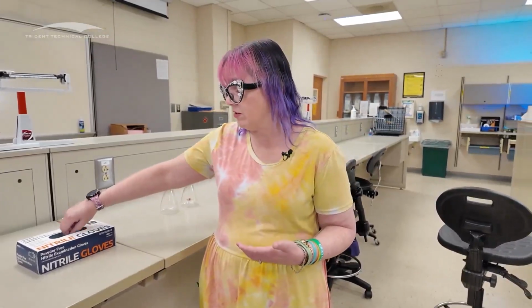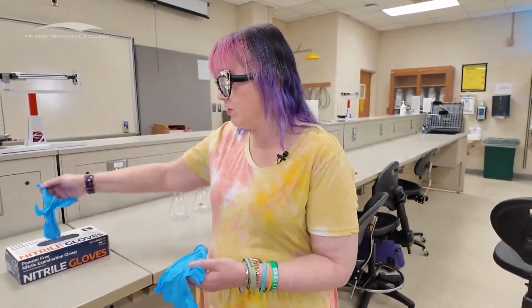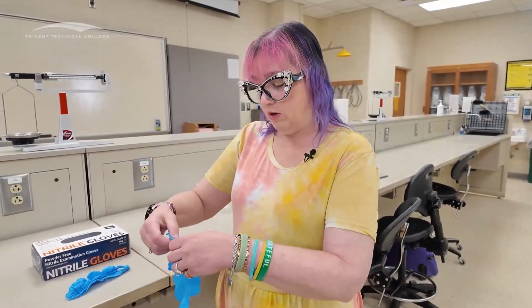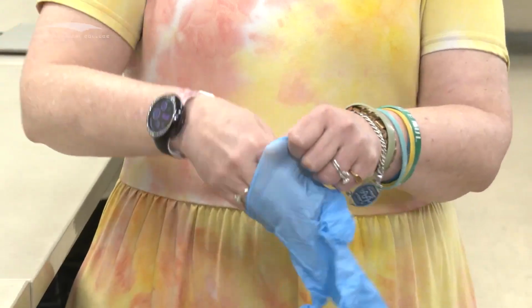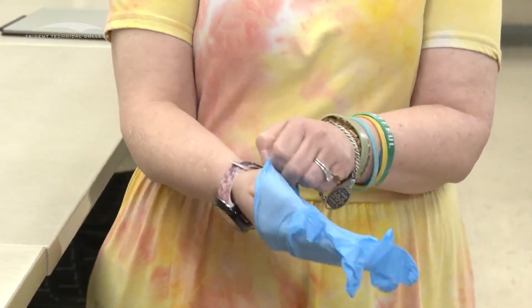For these, it's necessary. So I want to show you how to properly put on a pair of gloves, how to take them off, and then talk about what are proper protocols for using those gloves in those experiments. So let's talk about how we put those gloves on. So we're going to take gloves out of this container. Here's one, here's two. I'm going to set those down. We're going to make sure that we put them on appropriately. So we want to make sure that we get our thumbs into the thumb spots on our gloves.